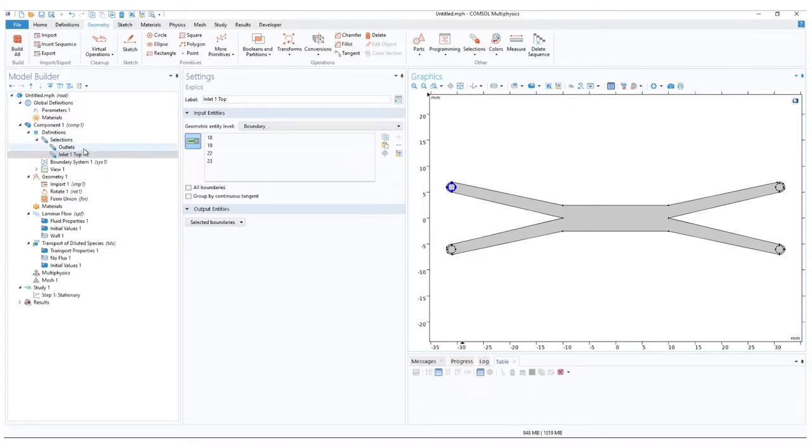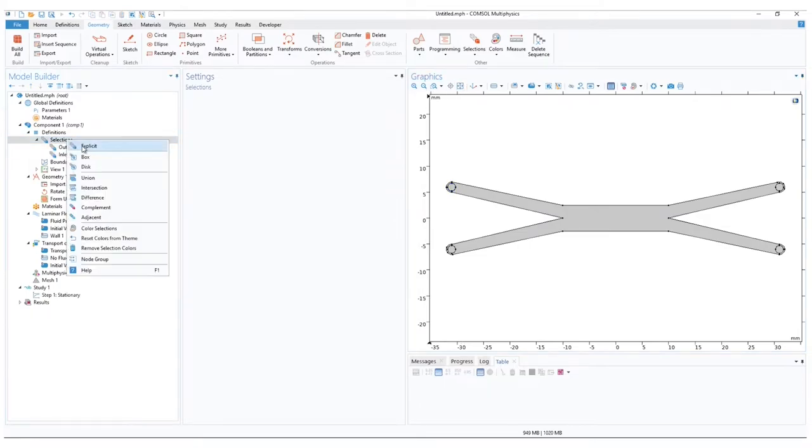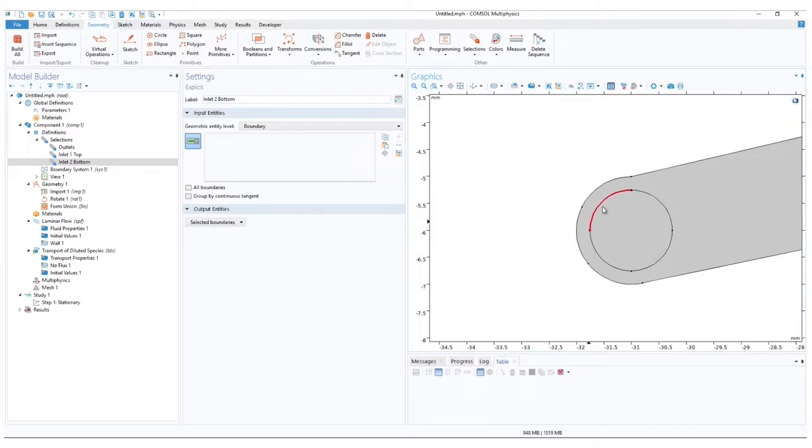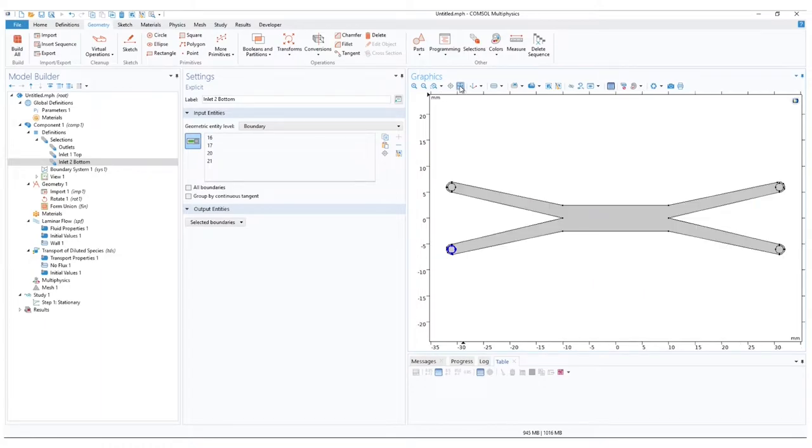Repeat this process for the second inlet. Don't forget to change the geometric entity level. Zoom in and select. With this, we have our boundaries defined, making it a bit easier while configuring physics.